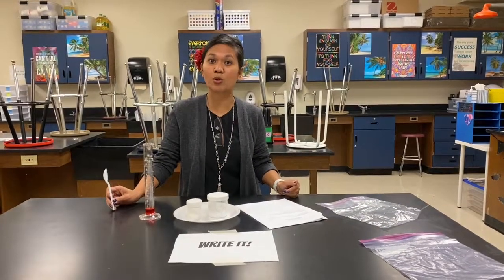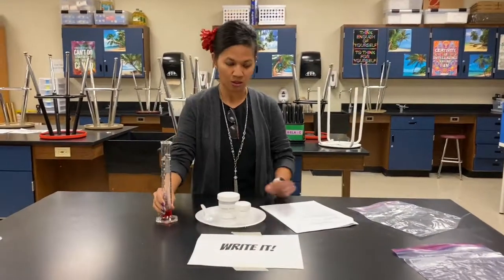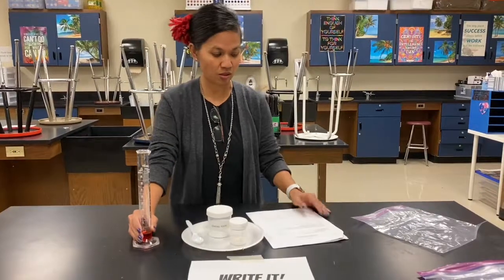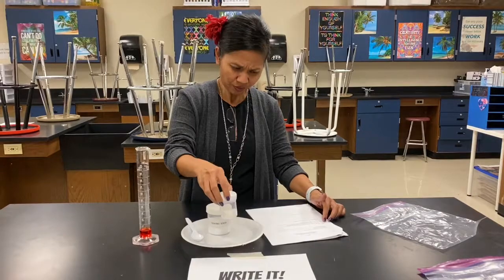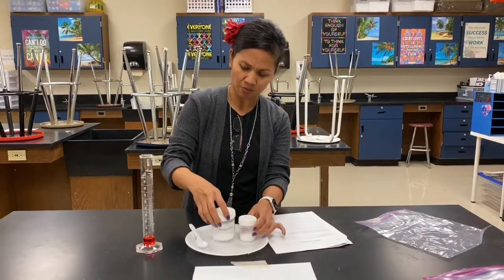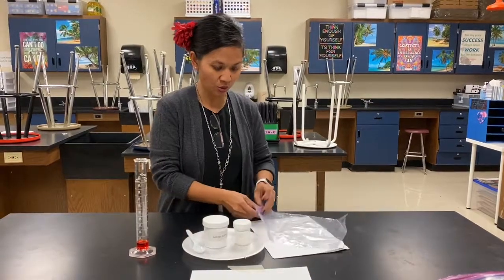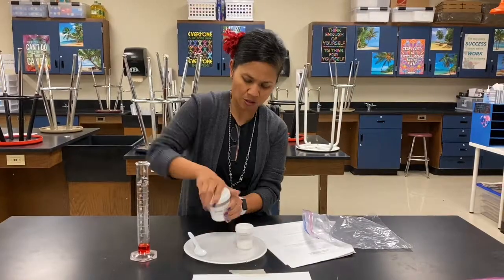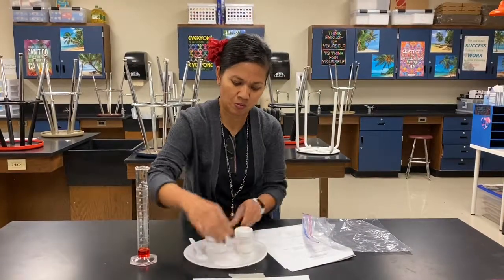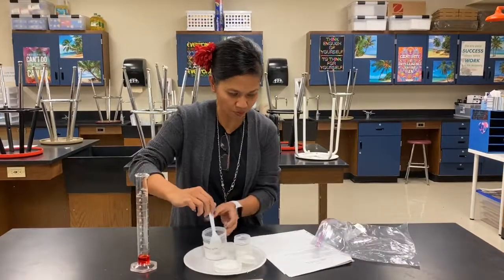Hey guys, today we're going to do an experiment on formation of a new substance. You will have on your lab table the materials and the directions that go with it step by step. So we have in this the calcium chloride, baking soda, and phenol red. For the first experiment, the directions say you only need one teaspoon of the baking soda.